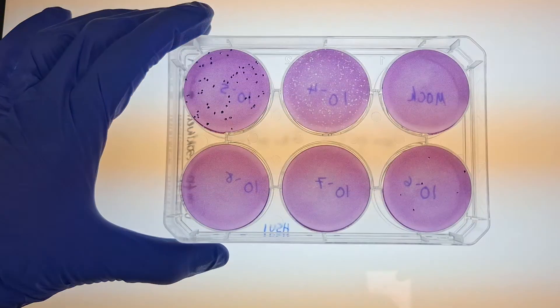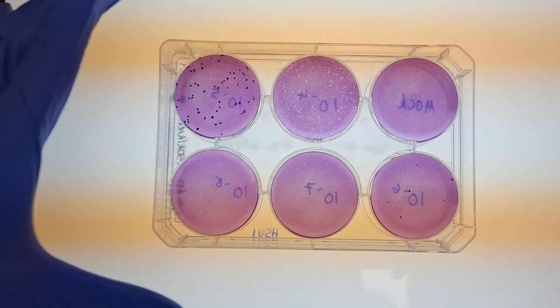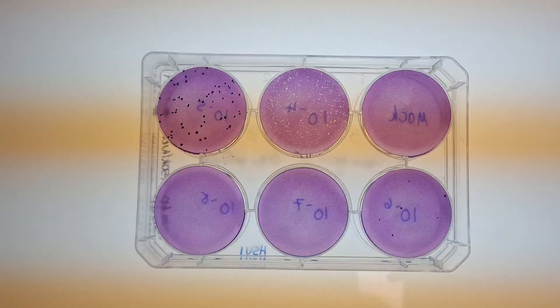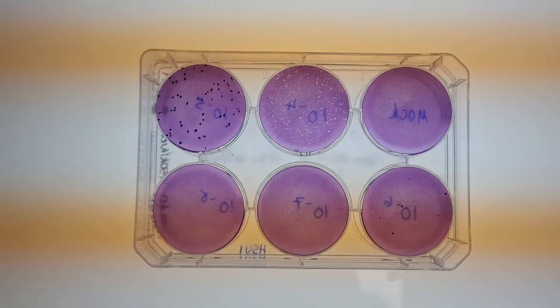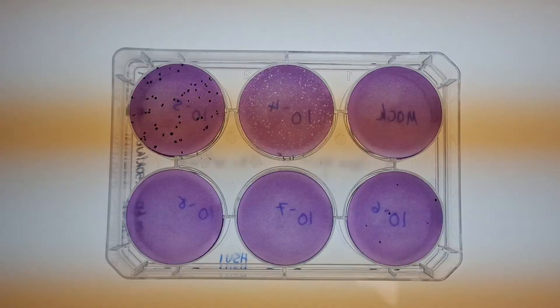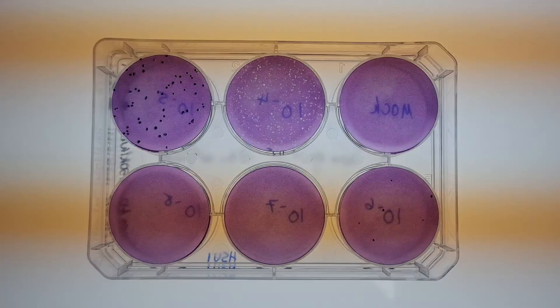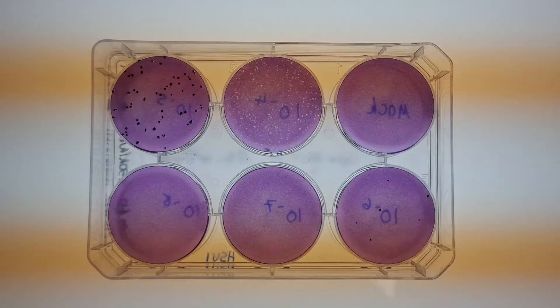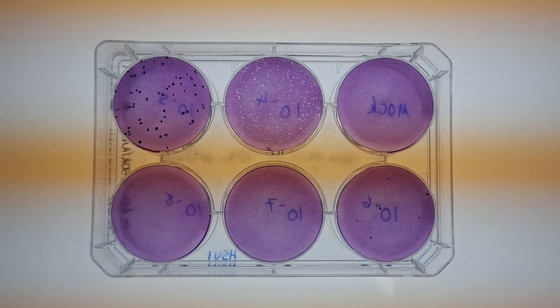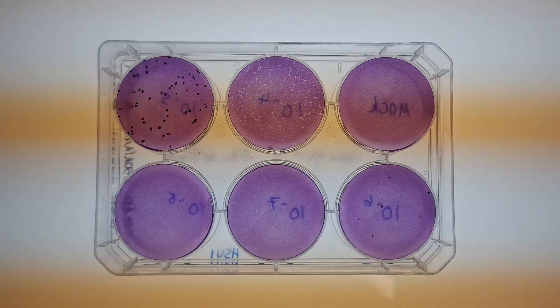Now we have everything we need to calculate the virus concentration in the original sample. First, we need to choose a dilution where the plaques are easy to count — not so crowded that they can't be accurately counted, or so few that the results become unreliable due to insufficient data. It's also important to work with replicates, counting plaques on all of them and calculating the average for more accurate results.